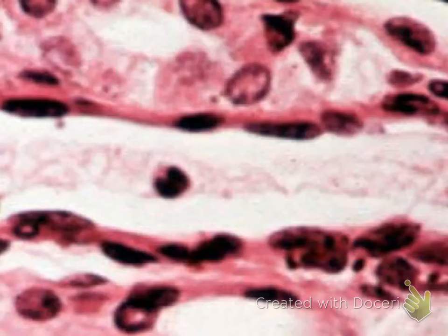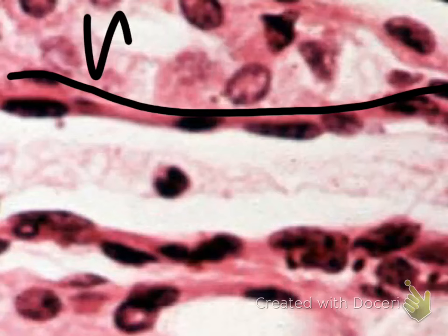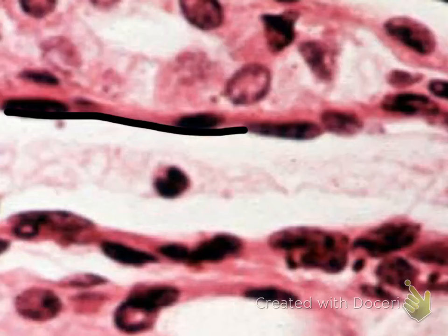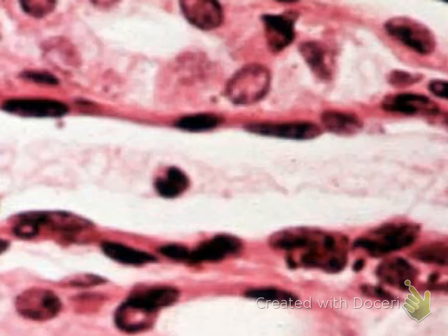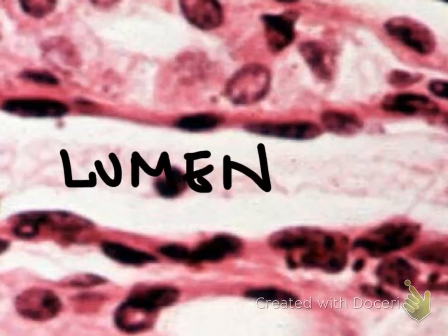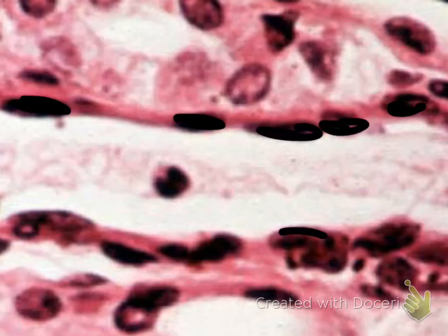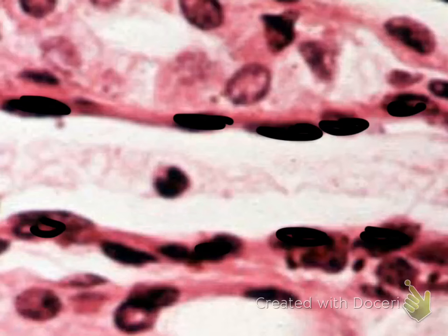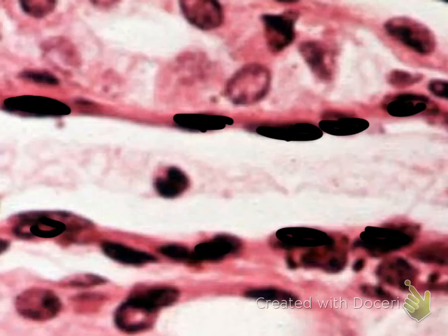First, identify the parts of the epithelium. Here's your basement membrane, which attaches the connective tissue to the epithelium. The apical surface is the portion that is not attached to anything. The space inside the tube — this is a tube — is called a lumen. Note the shape of the nuclei are flat, disc-shaped, and notice that there is only one layer. One layer tells you it's simple; the shape of the nuclei tells you it's flat, so this is simple squamous epithelium.